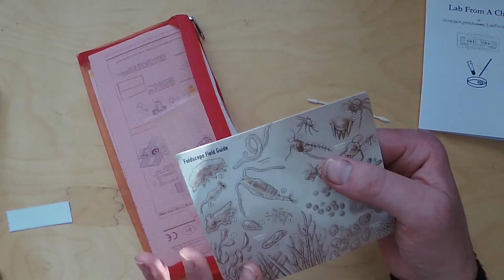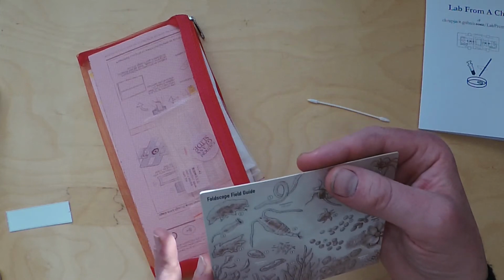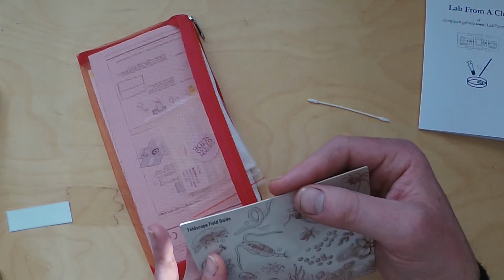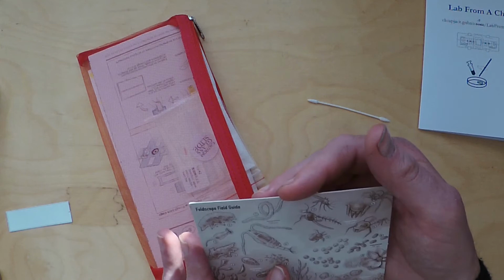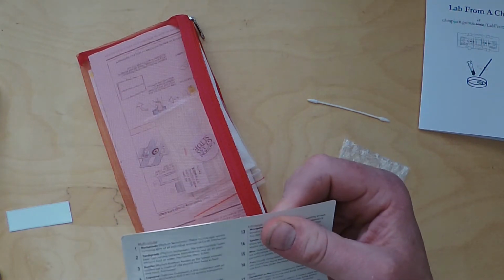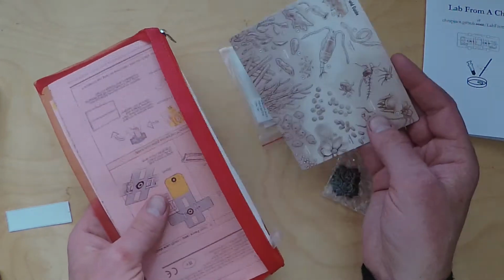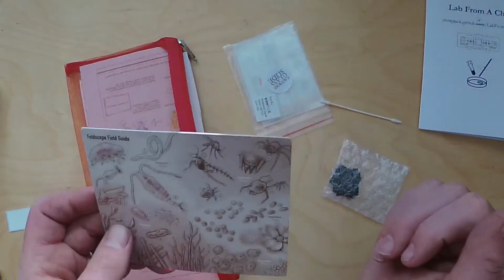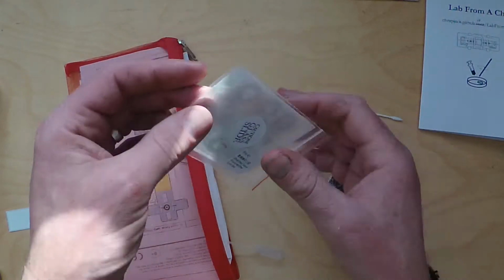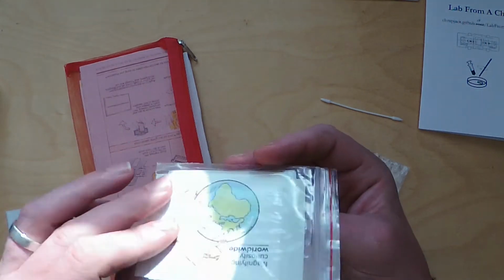These are the sort of organisms you'll be able to see, from nematode worms, another famous model organism, to tardigrades, which are quite exotic things. Unfortunately we don't have any tardigrades for you, but maybe that's another project. Anyway, so there's a little bit of artwork there. So if we just take those out for now, I'm going to put them out of sight. I'm going to put our example reference slide out of sight.